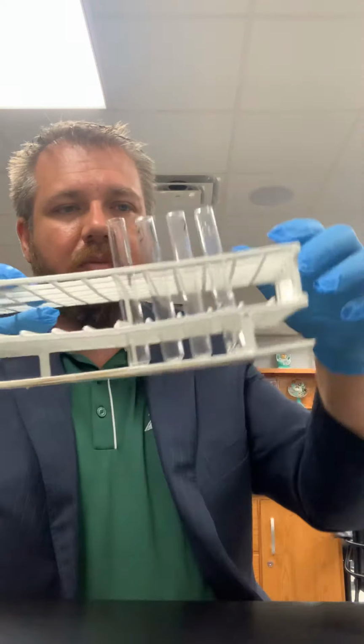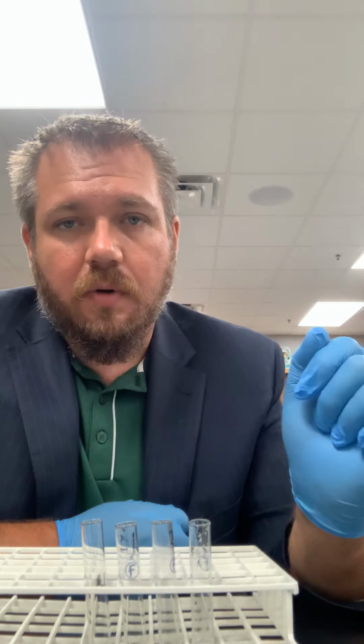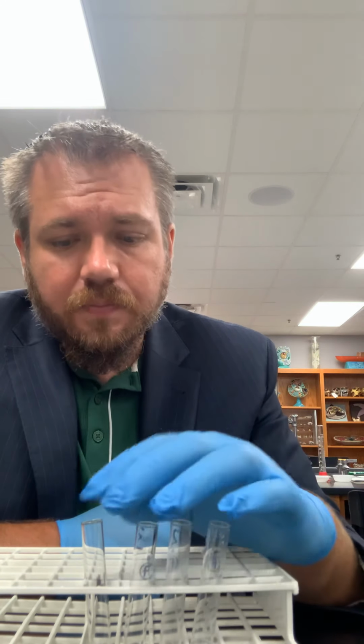In this case, you're going to set up a series of dilutions. And what we're going to use is red food dye. So you're going to easily see your dilutions and how you do with the dilutions. So in this part of the lab, this is when you use the larger test tube rack. That's when you use the larger glass test tubes. So I think in the handout it tells you to gather these and label them. And we're going to have them labeled for you. So you should see on there, it should say 1, 2, 3, and 4. So make sure they're in the correct order so that you know what goes where.